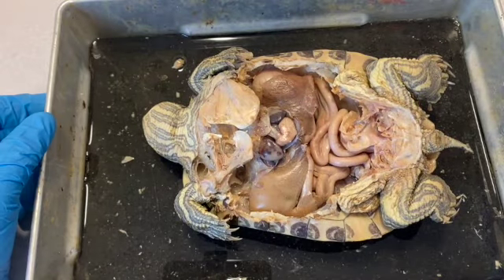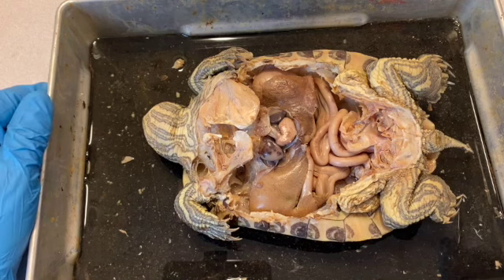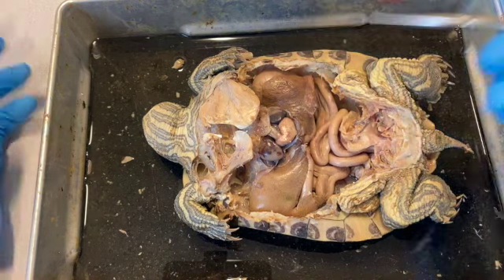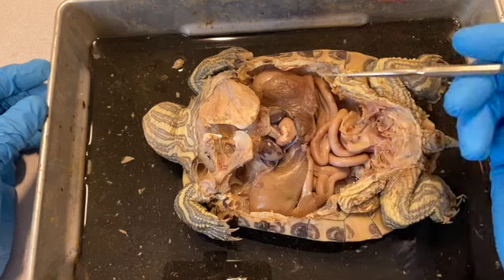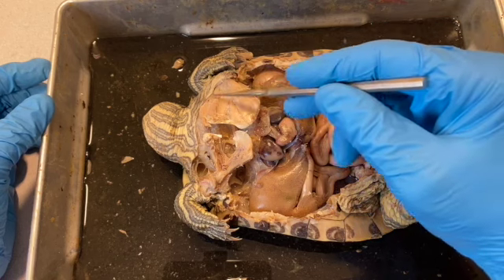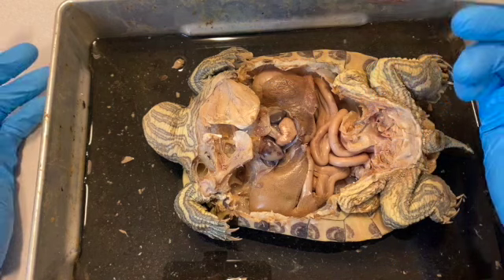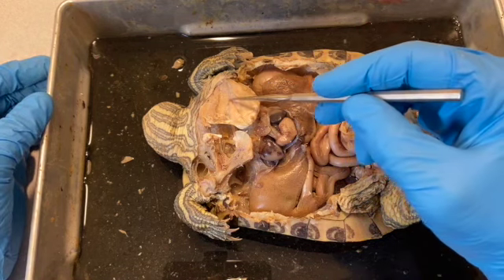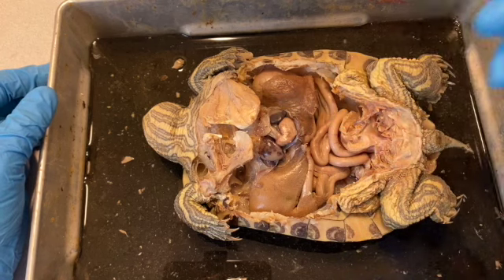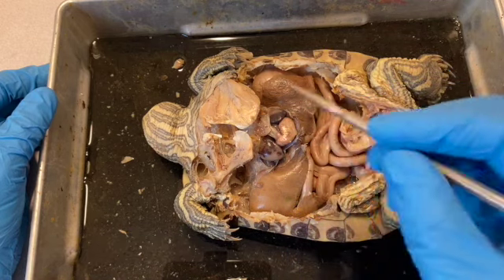Okay, with the peritoneum, that white tissue, removed, let's take a look at what's inside. So over here on this part, the pectoral muscles, which were here and here, have been removed. These muscles, which are still covered by a layer of peritoneum, are the deep muscles, or the muscles of the coracoid. And I'm not going to go into the detail of which ones are which, but there are multiple muscles in here, as you can see. And these bones and these muscles are all part of the pectoral girdle. On this side, all of the muscles have been removed, and we can see two bones.